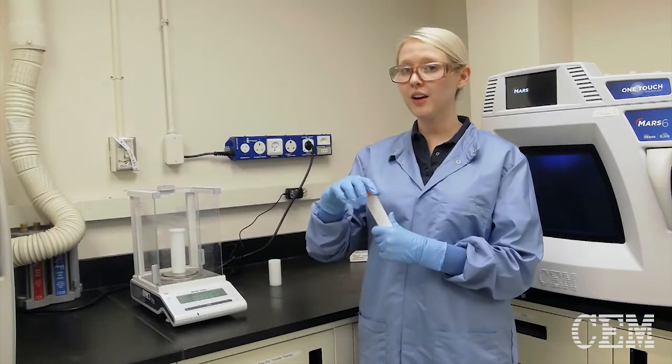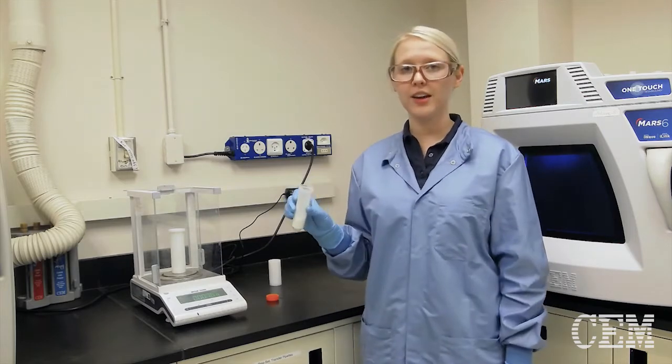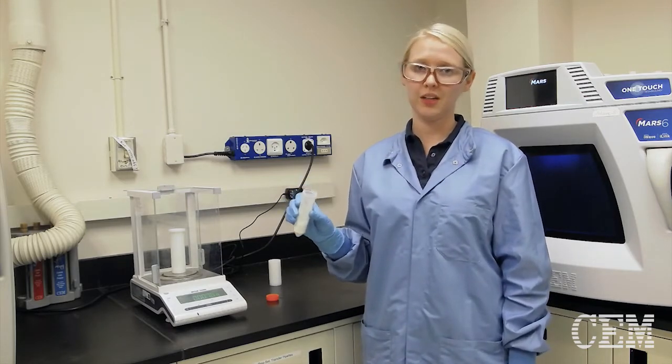Now that we have it ground, it's in a fine powder that can easily be weighed up into my vessel.